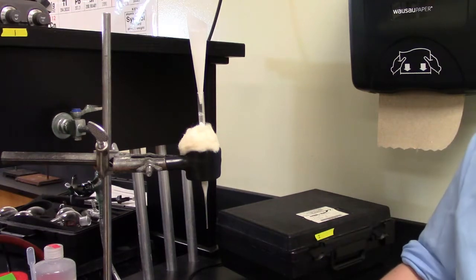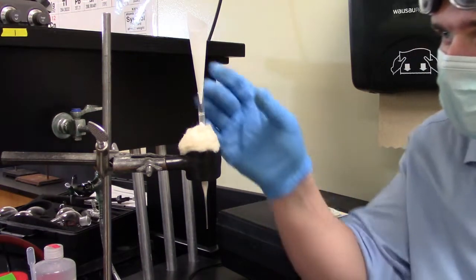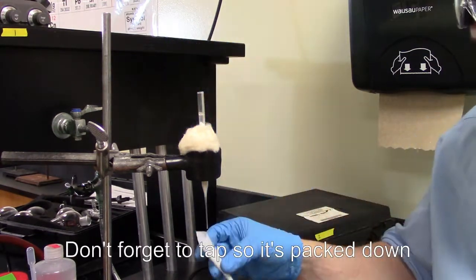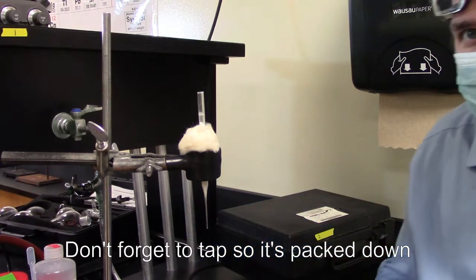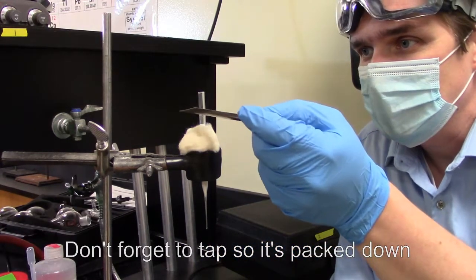All right. So I've got it in there. I'm going to pull my funnel out so you can see. And you can see there's still a lot of silica powder in there. And I'm also going to give it a few taps.